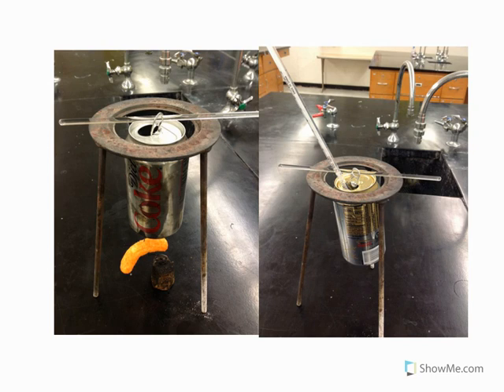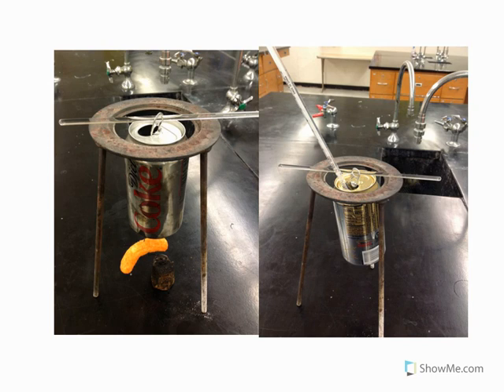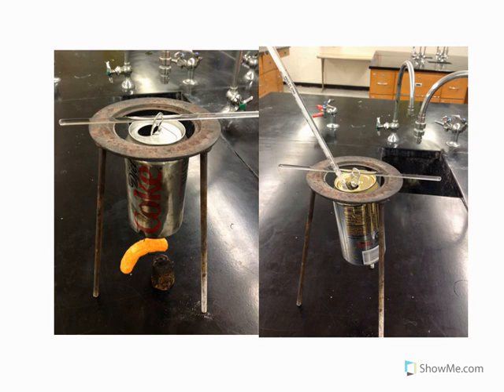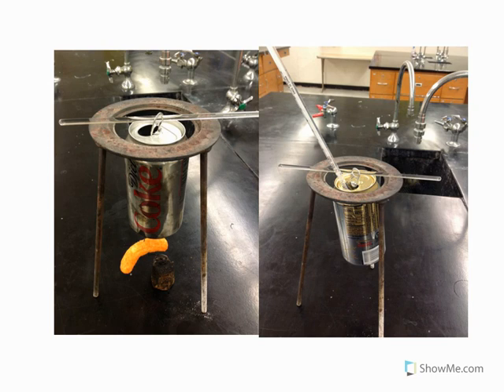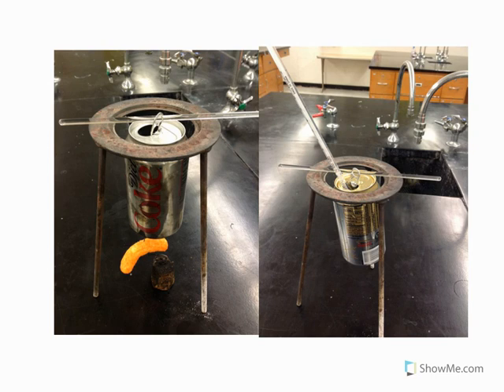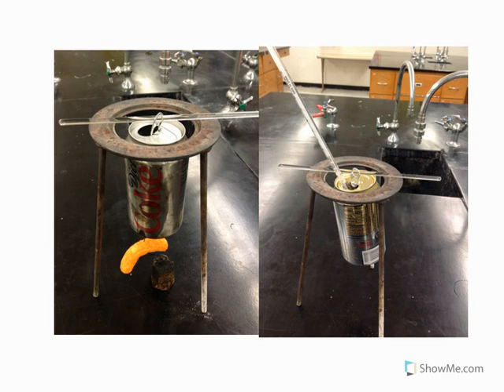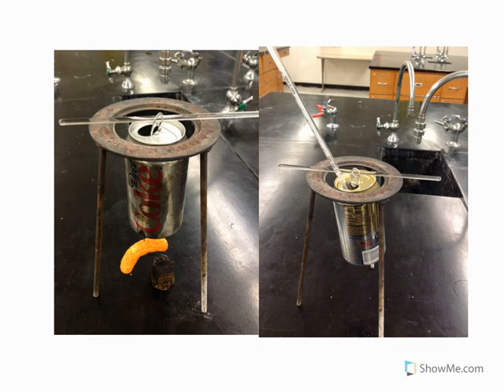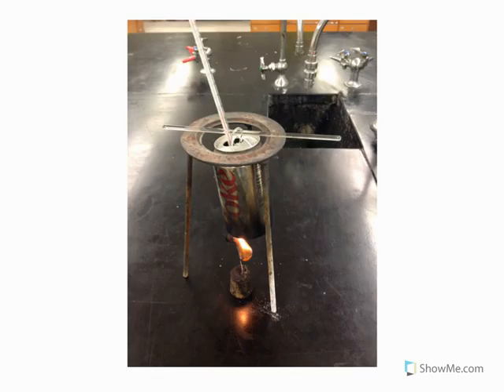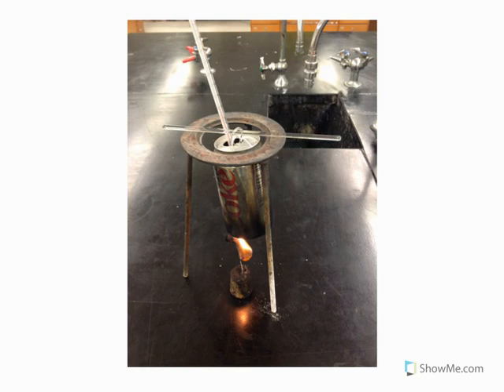Bend the top tab on the can up and slide a stir rod through the hole. Suspend the can on a tripod, as shown, and then have the food holder and the food underneath it. Insert a thermometer into the can and measure and record the initial temperature of the water.